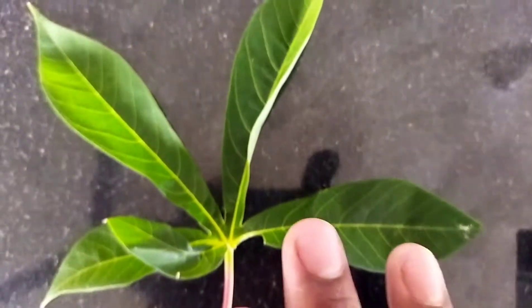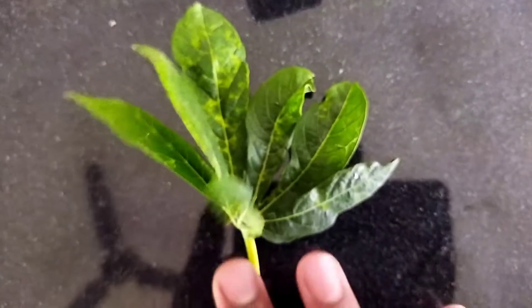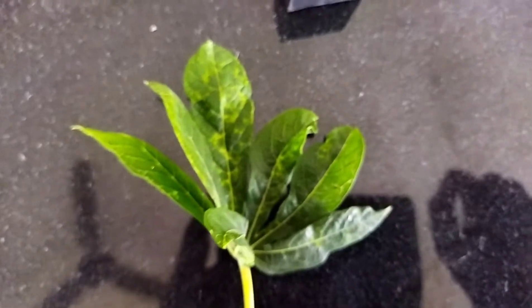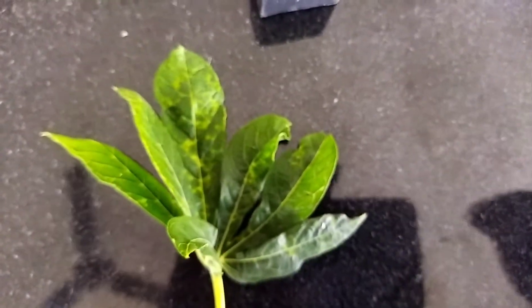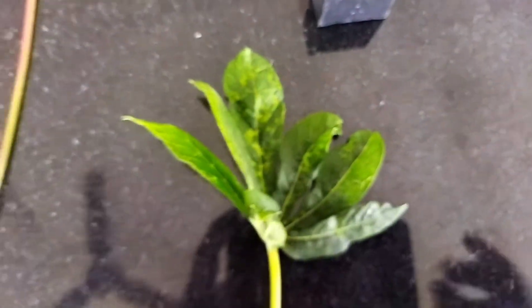I have taken two types of samples for clarification — one is a healthy leaf and another is a cassava mosaic infected leaf. I dissected the midrib and petiole portions from both healthy and infected leaves and separately soaked them in tetrazolium solution.